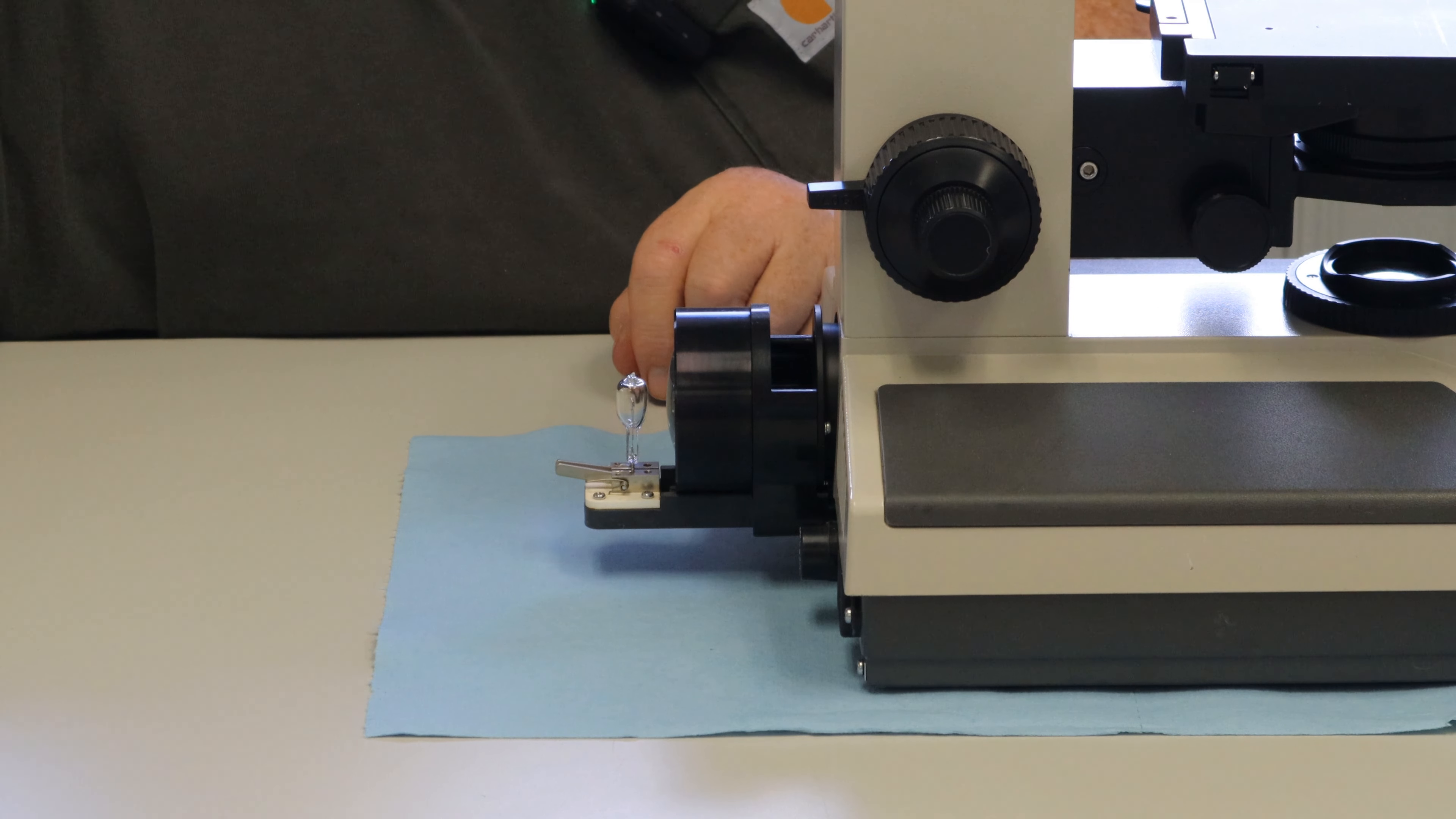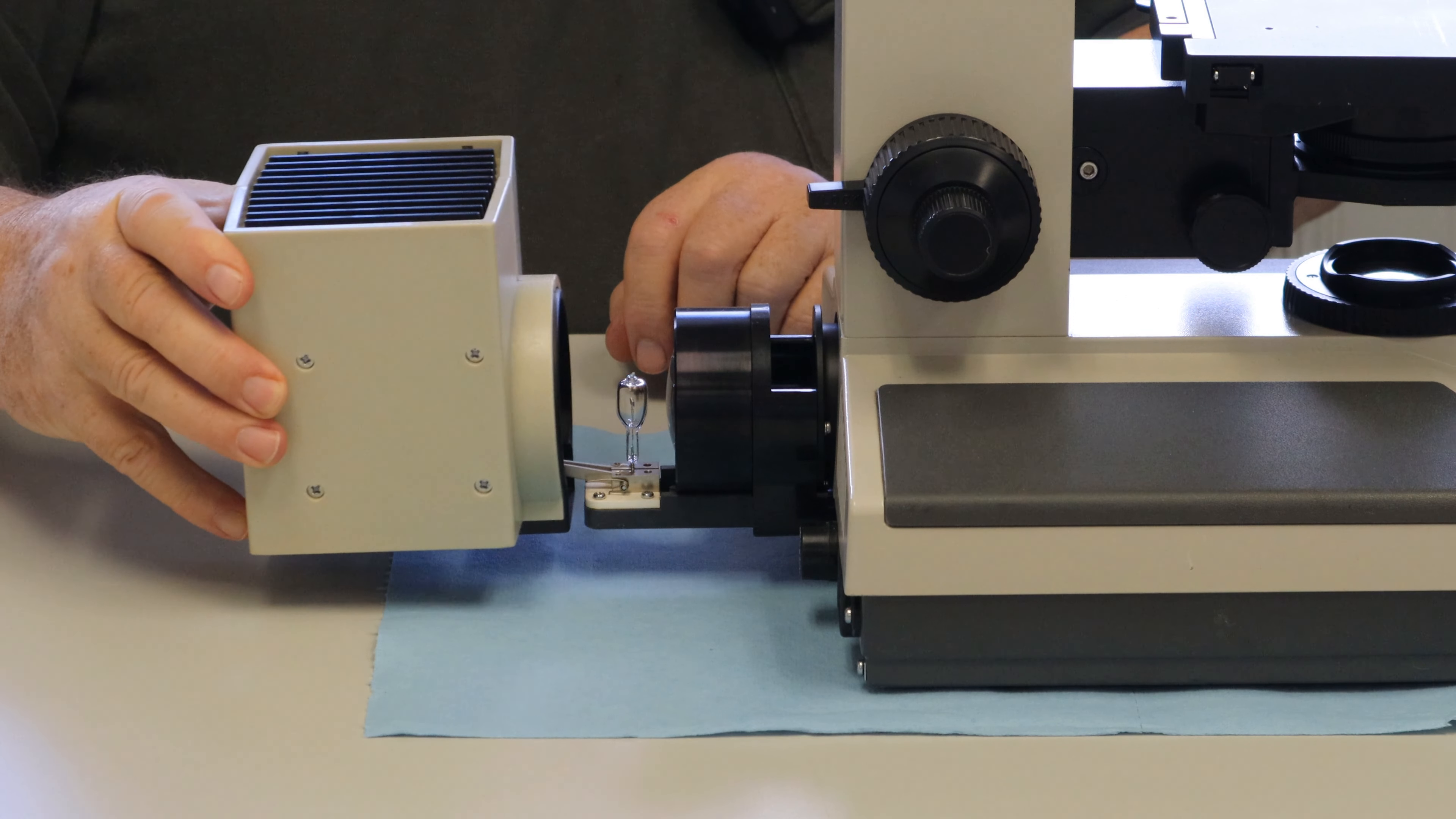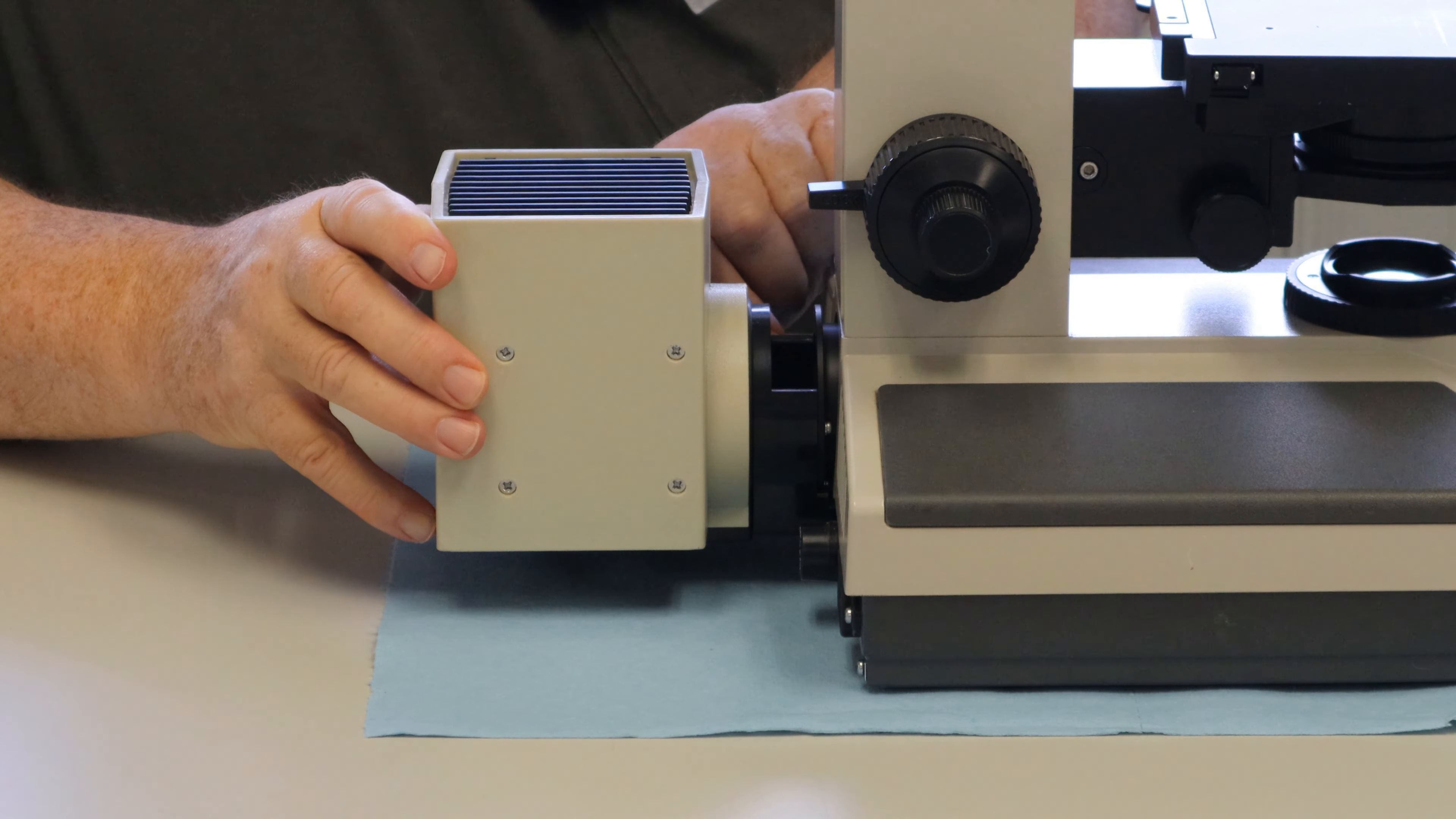And that was very fast and easy. And now you're back up to run your specimens.